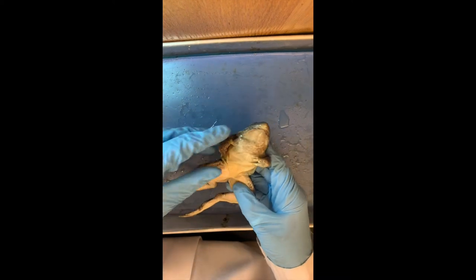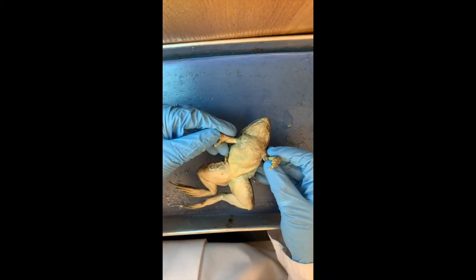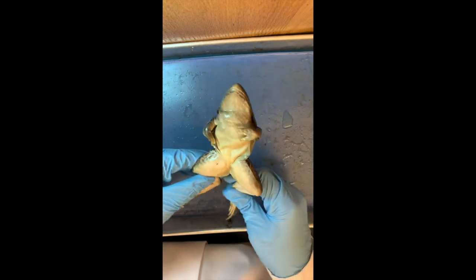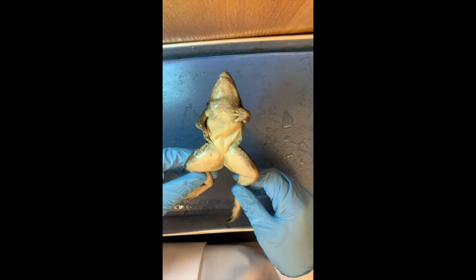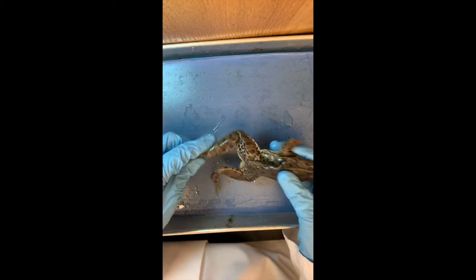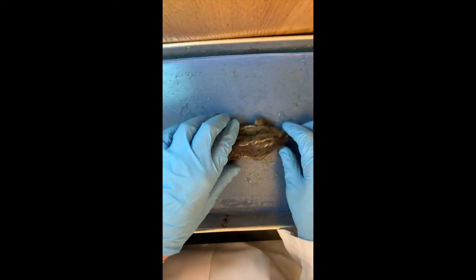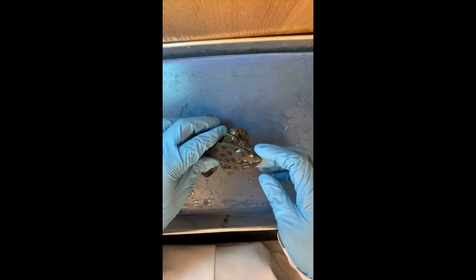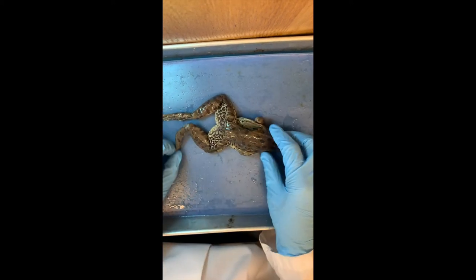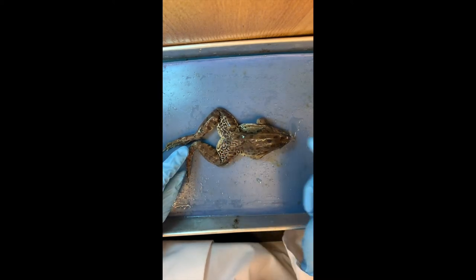It's a tetrapod — tetra meaning four limbs. Is it an arthropod? It has jointed legs, it might be an arthropod. No, because arthropods have an exoskeleton. This is not an exoskeleton — that's too soft. No compound eyes either. So endoskeleton then? Yes, inside. They have vertebrae, so vertebrates — amphibians like frogs, newts, and salamanders.